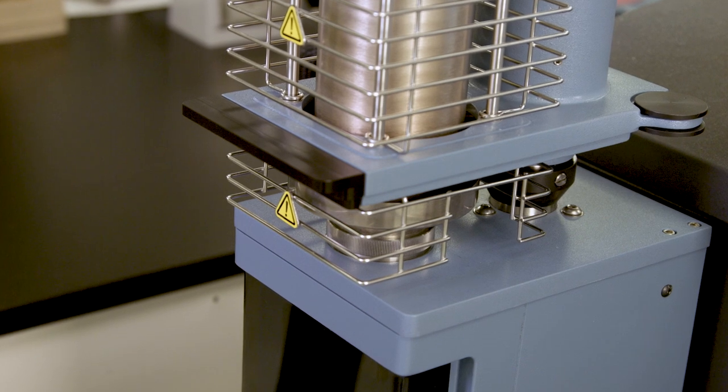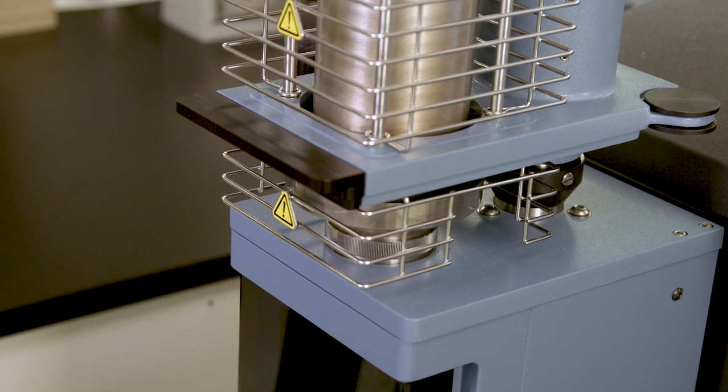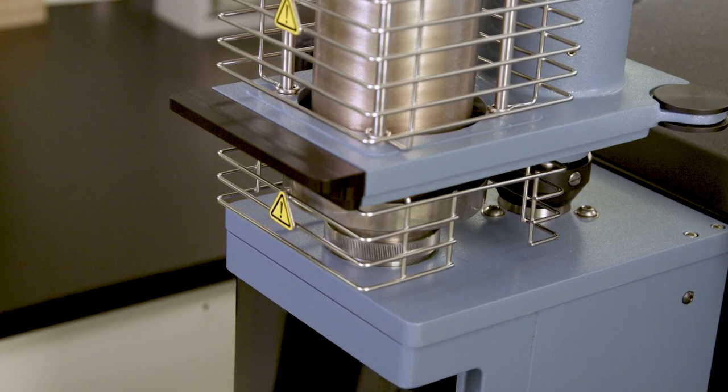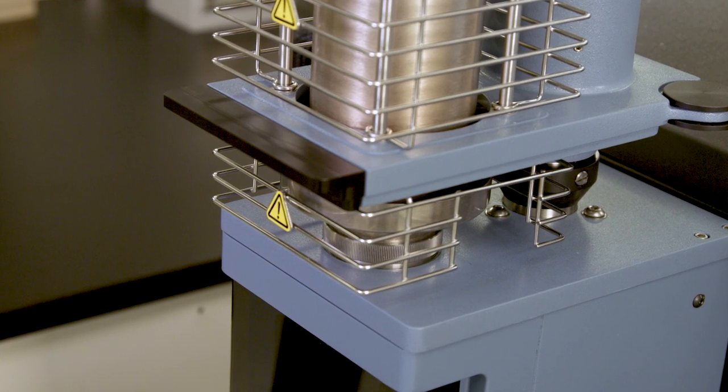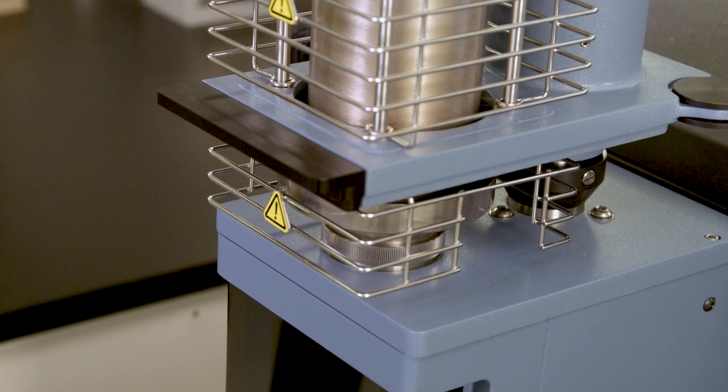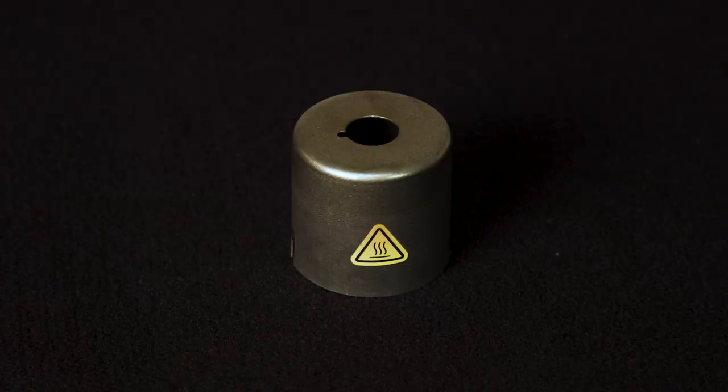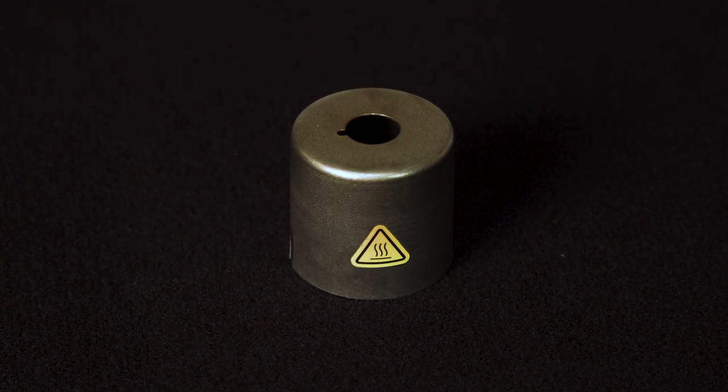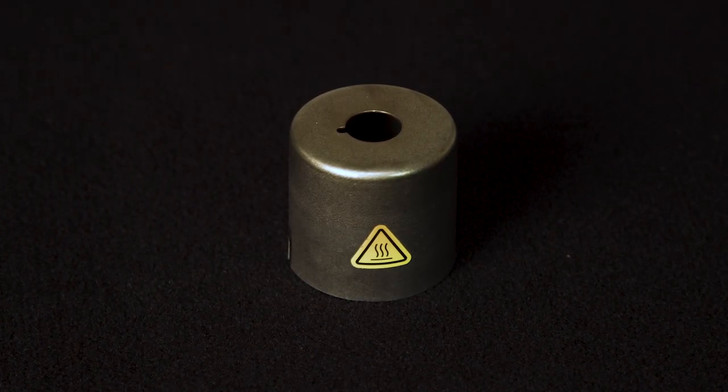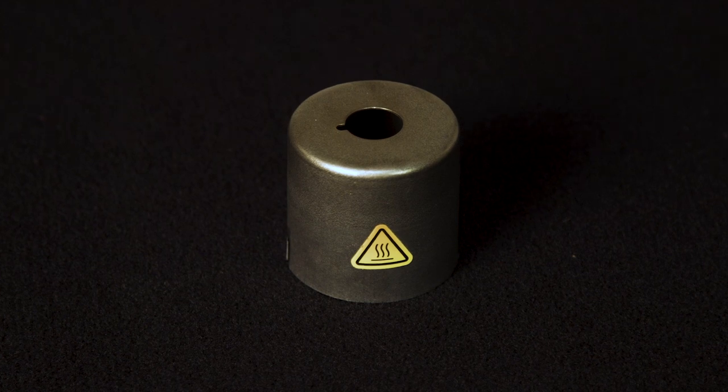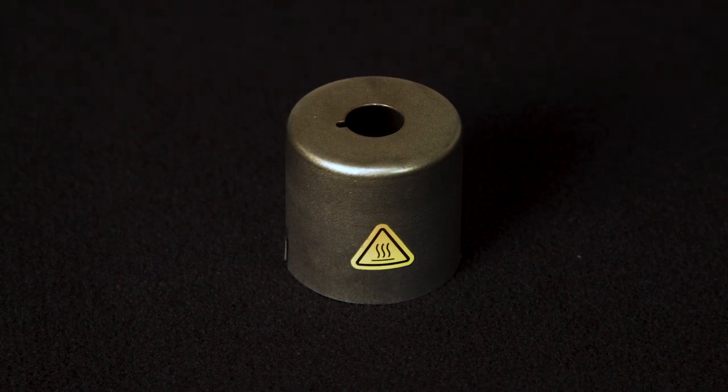If the mechanical cooling accessory MCA 70 is connected to the instrument, the drain cup and drain tubing should be installed on the stage. If you're not using the MCA and your test runs below 600 degrees Celsius, use the aluminum stage shield instead.